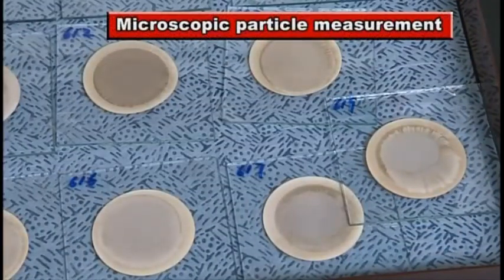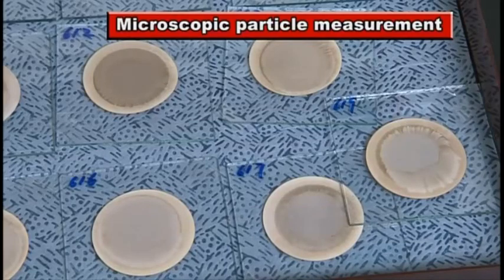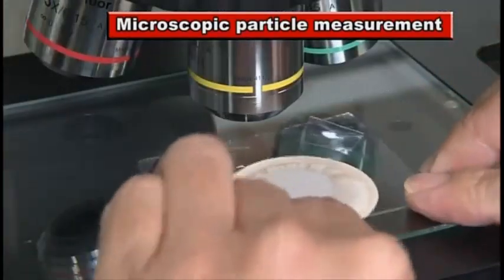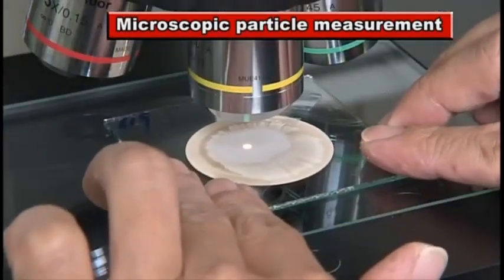Types and content of fine particles are measured by means of microscopic observation.